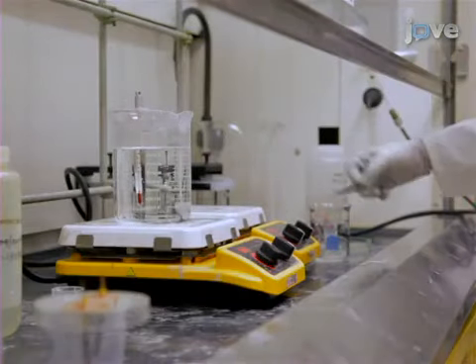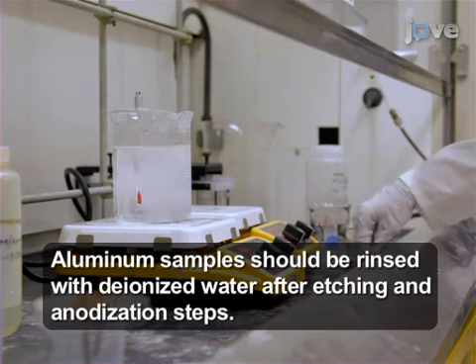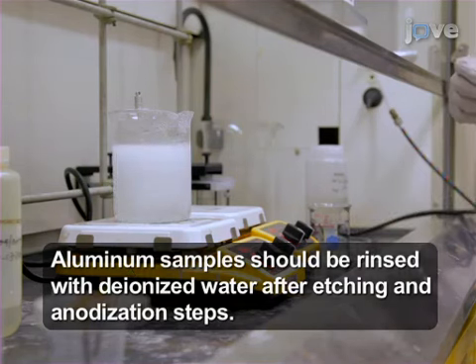Submerge a small number of the sheets in a beaker of nitric phosphoric acid etchant at 80 degrees Celsius for five minutes.